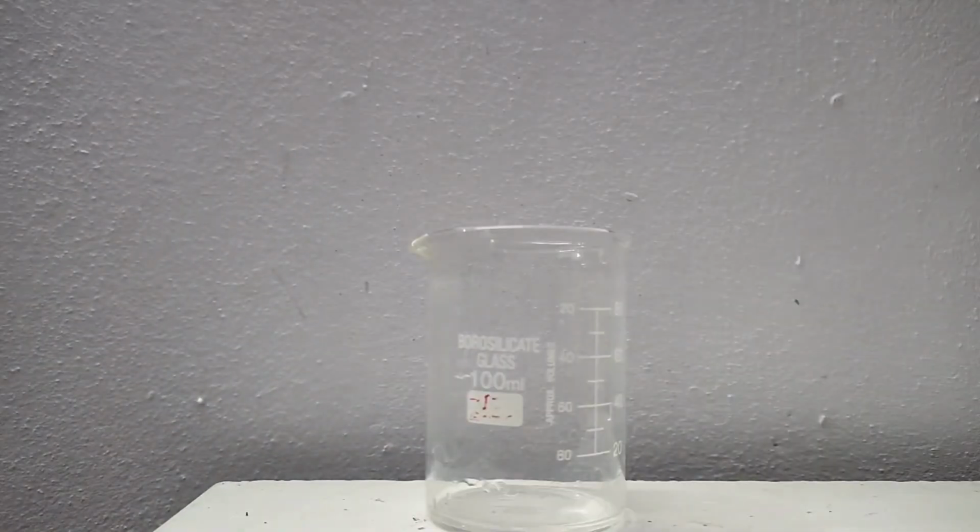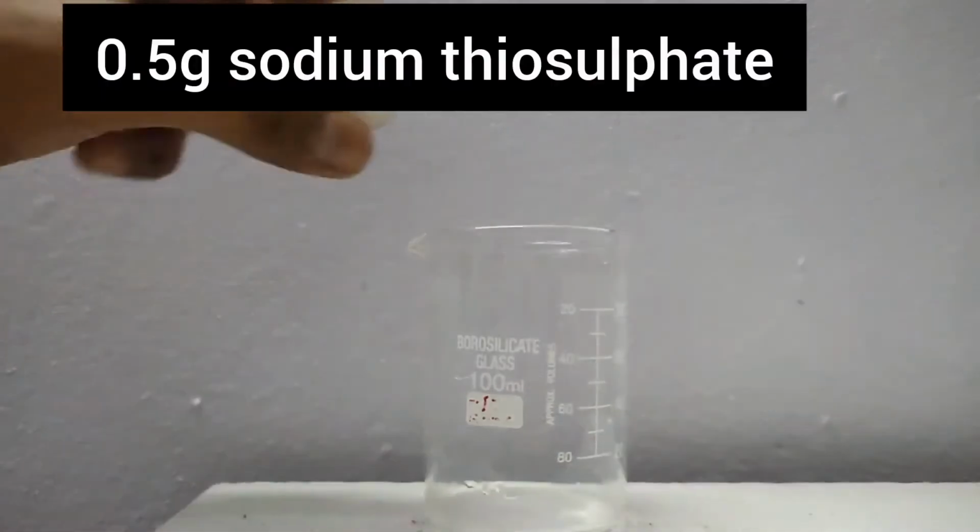You can see that our sun has turned yellow in color, and now it is going from yellow to red, and now the sun is not even visible. This beaker is a representation of the sky. The reaction went way faster than I thought.